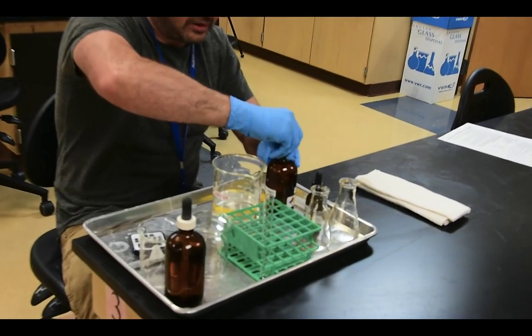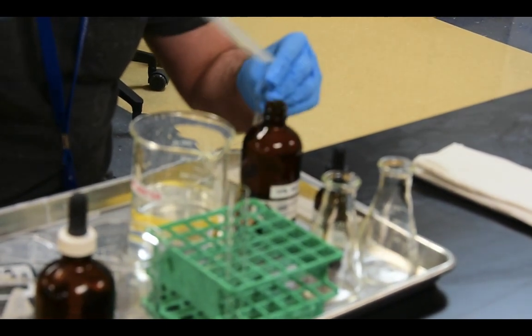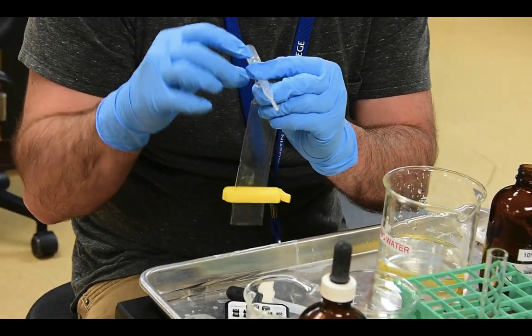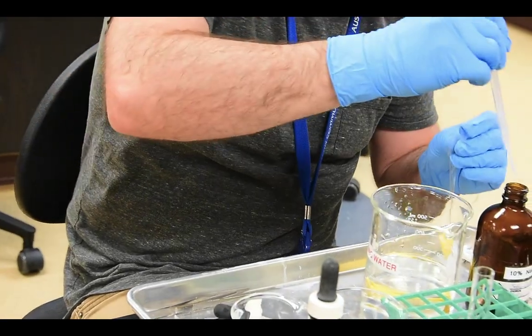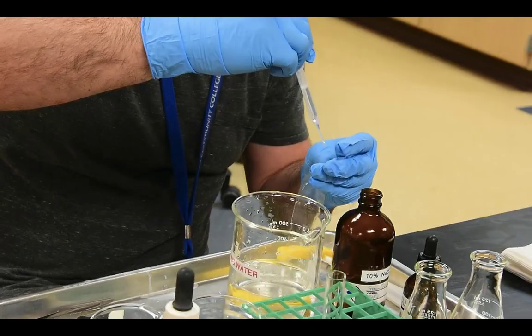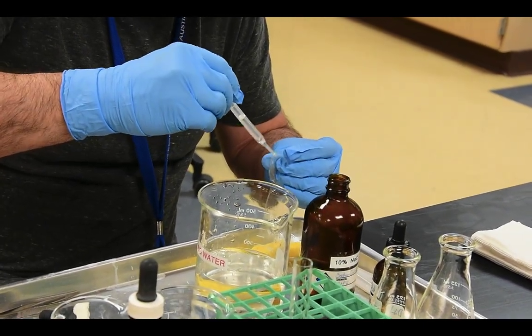So I'm going to take this off, and I'm not going to use my dropper here. I'm actually going to use my micro pipetter. Now this is a 3 milliliter micro pipetter. Every one of these little horizontal lines across the side indicates a milliliter, so I'm just going to use multiple of these so I can standardize my bag a little bit more carefully. It'd be nice if I had somebody to help me hold this bag open. Good thing you guys will when you have your groups.